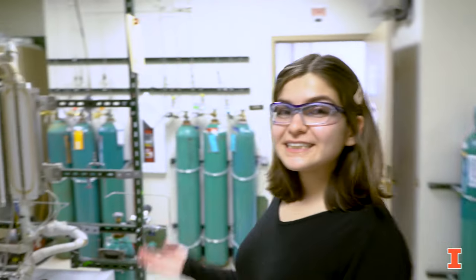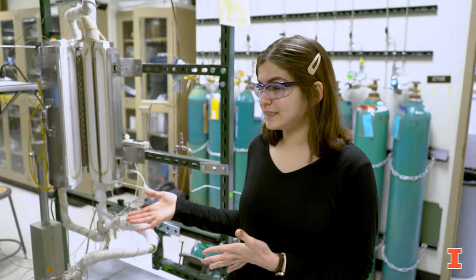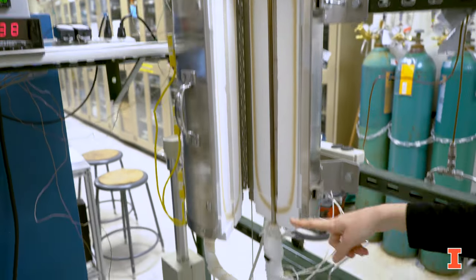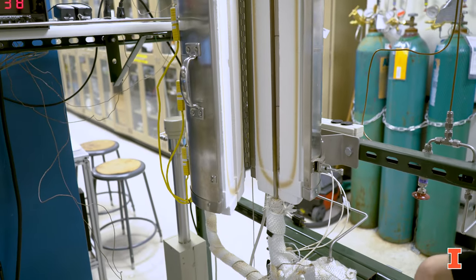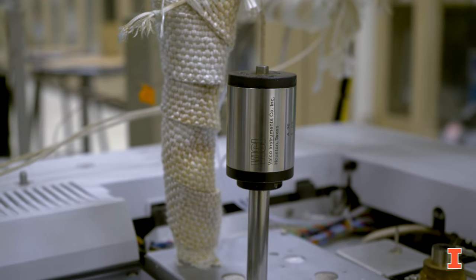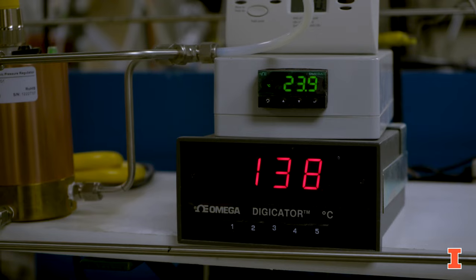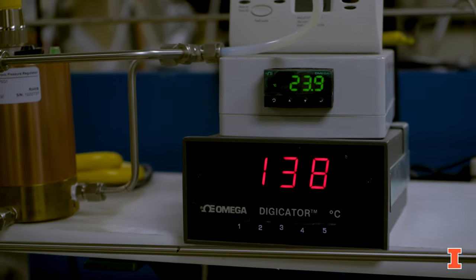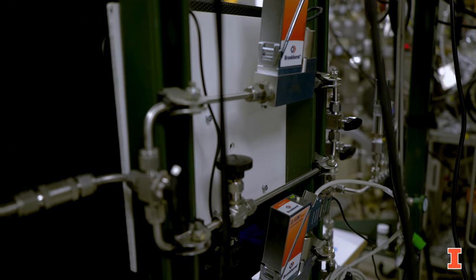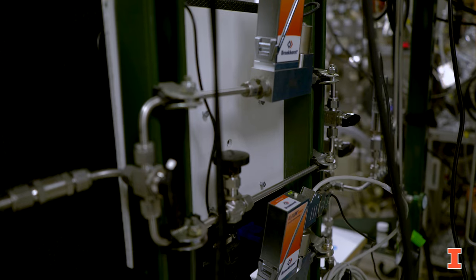This next system is a high-pressure hydrogenolysis system, which consists of a packed bed reactor and is fully capable of fully automated pressure, temperature, and gas and liquid flow control. An online gas chromatograph is able to measure steady-state kinetics for this reaction.